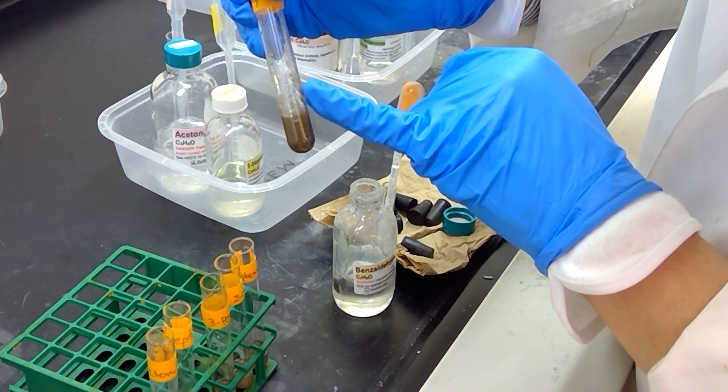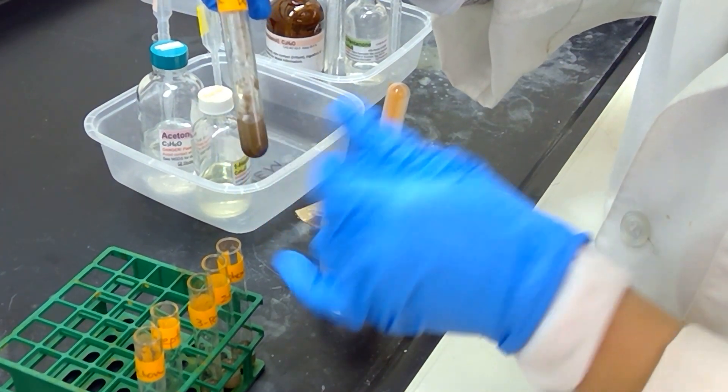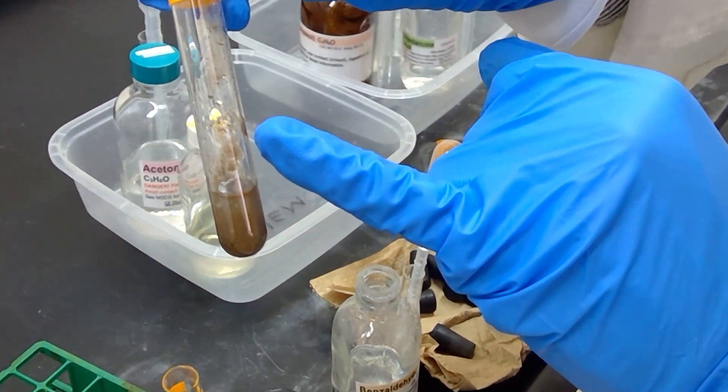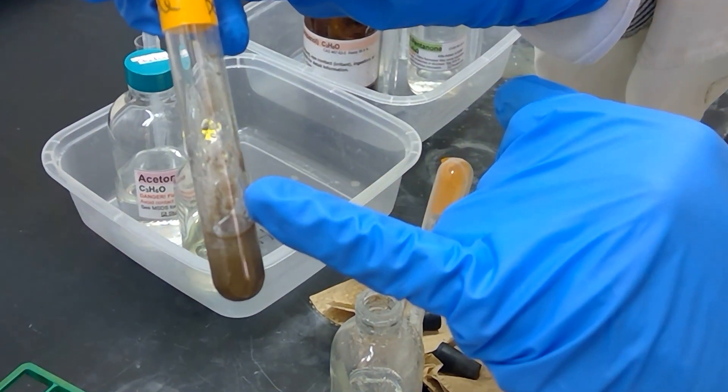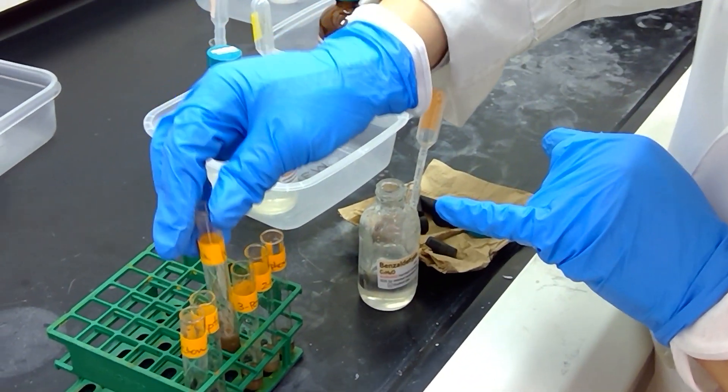Let me shake up the test tube a little bit. We might start to see this turn a little more solid in just a few moments. If you notice here closely, we are starting to get a little bit of silvery solution forming on the end of the test tube right here. So far, so good.